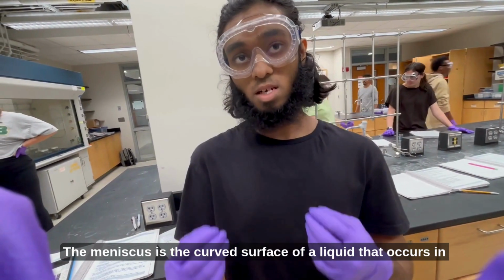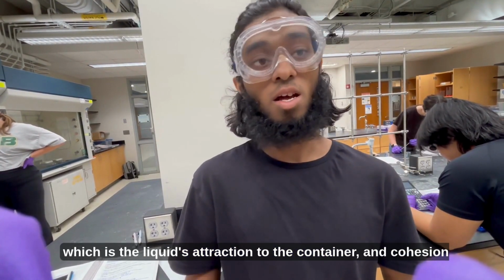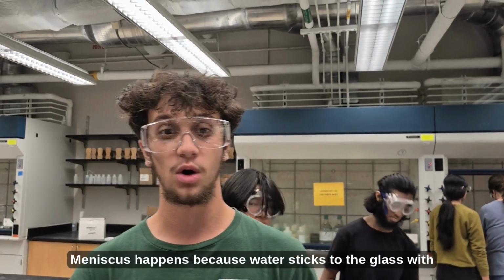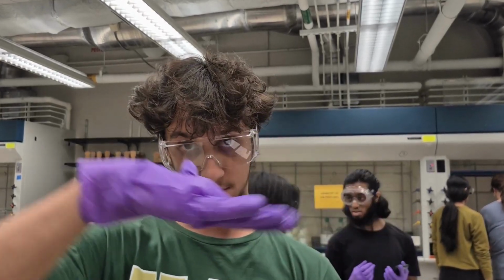The meniscus is the curved surface of a liquid that occurs in a container due to the interplay of adhesion, which is the liquid's attraction to the container, and cohesion, which is the liquid's attraction to itself. Meniscus happens because water sticks to the glass with adhesion, so it climbs the sides and makes a concave curve.